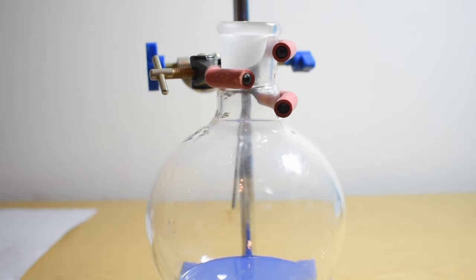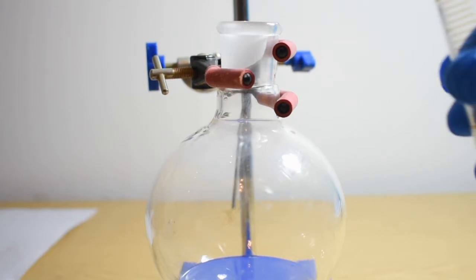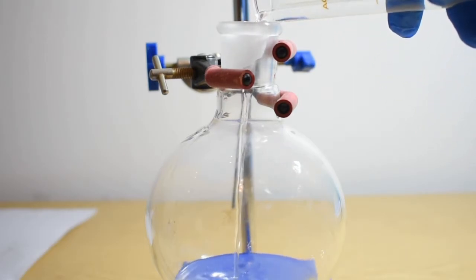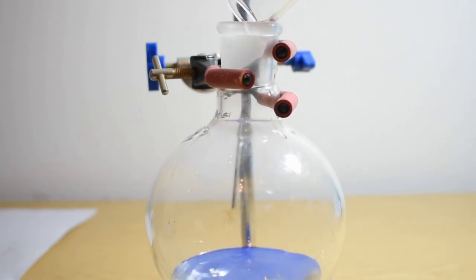Next I add 20 milliliters of glacial acetic acid and once that's added I'm going to add the acid catalyst which is 3 milliliters of concentrated sulfuric acid.